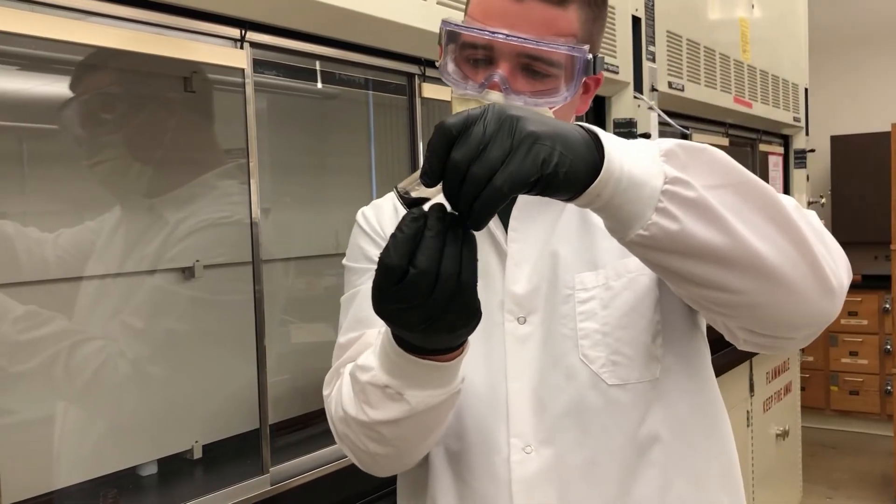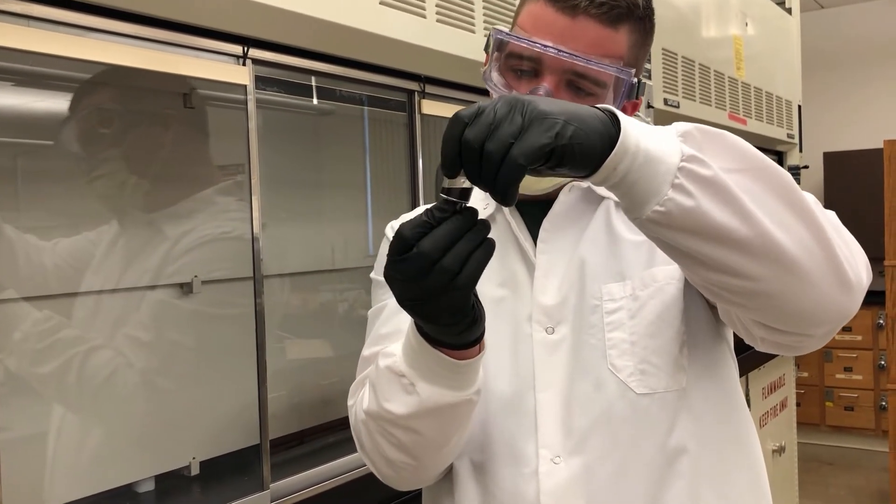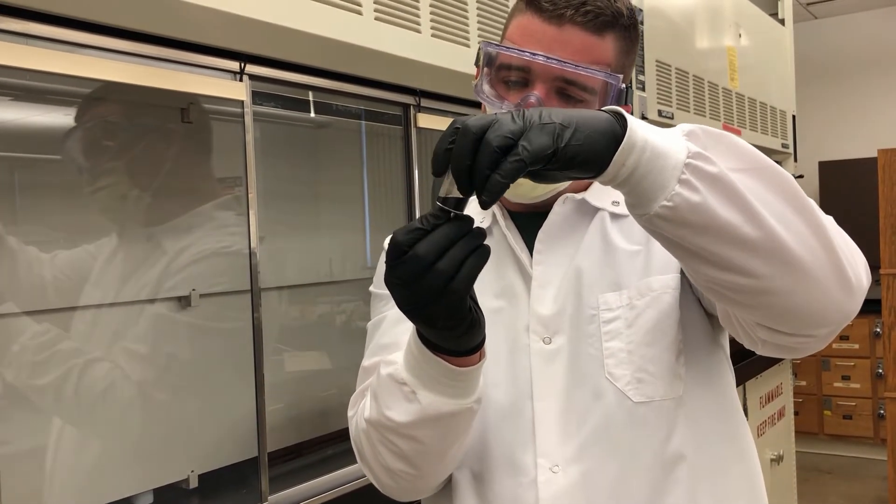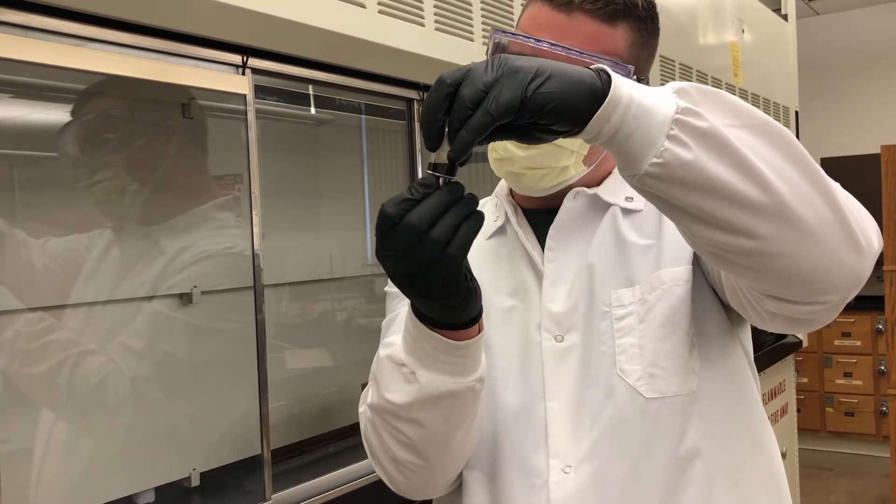Okay. So this is our surfactant and as they mix, hopefully what we'll see is that the ferrofluid should become more reactive as we do this.